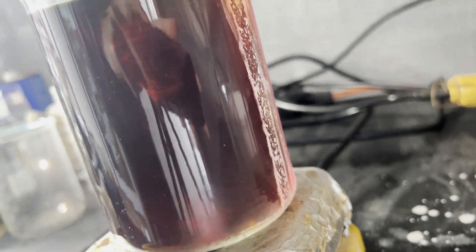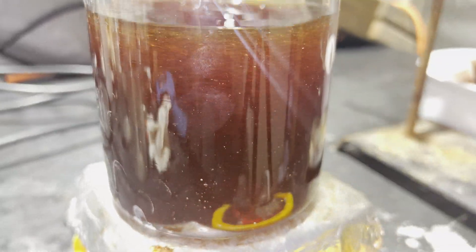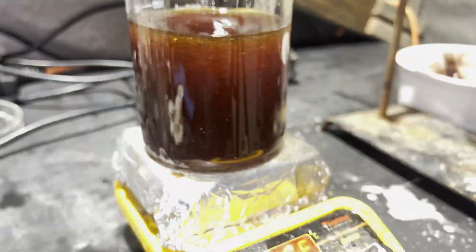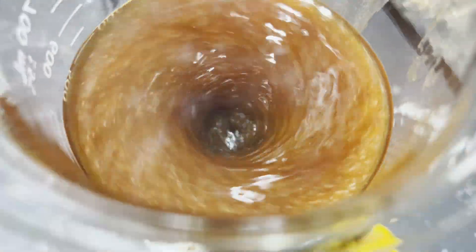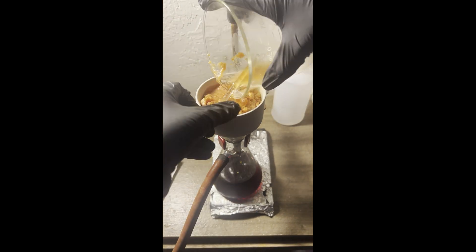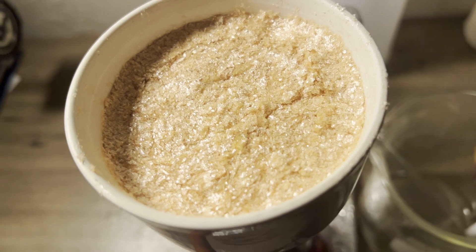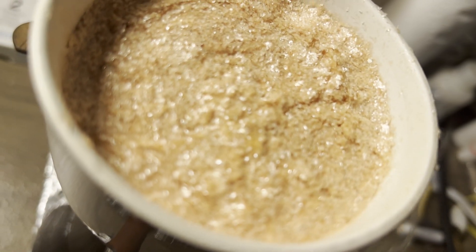Once the filtration and washing steps were done and my phone was recharged enough, I'm stirring the filtered mixture and heating it back to boiling so that once the excess ethyl acetate boils off and the solution cools down, the crystallization is as uniform as possible. Once it's at about room temperature, I put the beaker in the freezer overnight, then filter it.